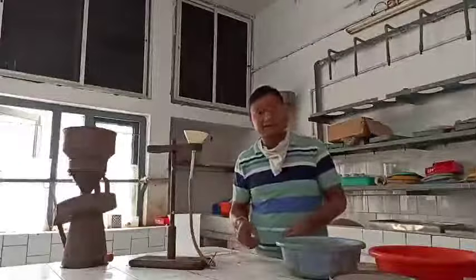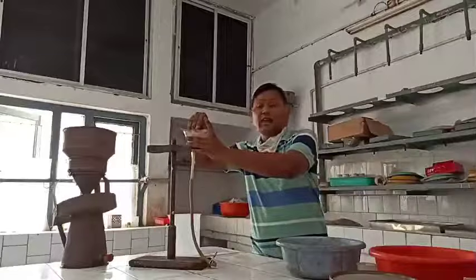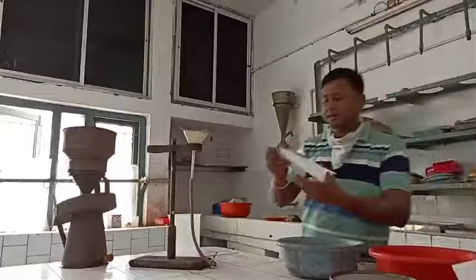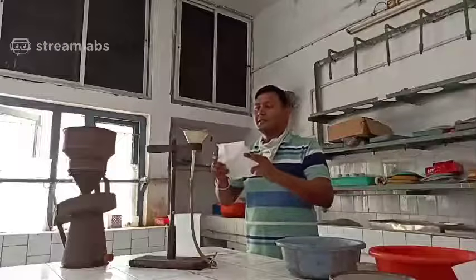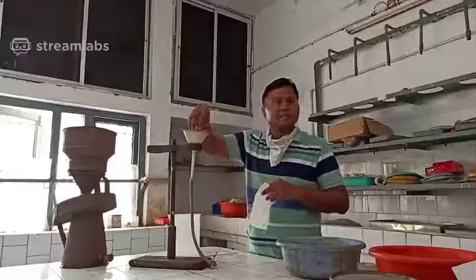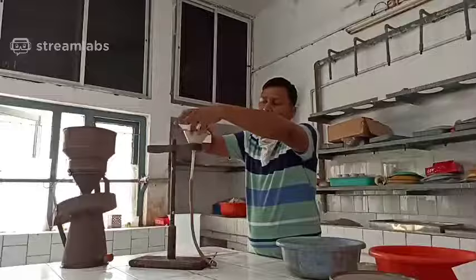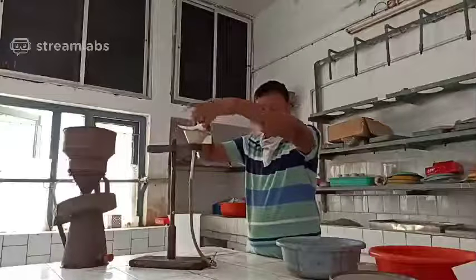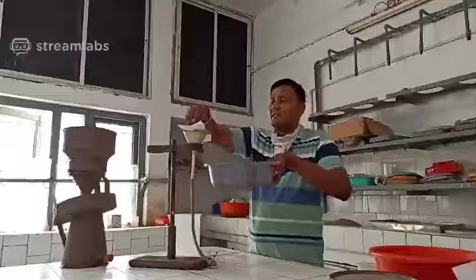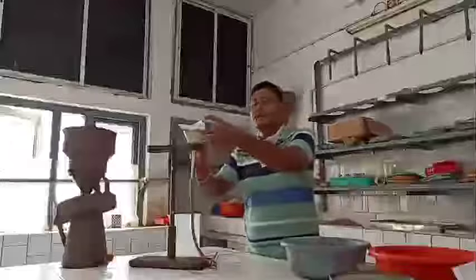Thereafter, this cotton bag was replaced by aluminum wire gauze and a tissue paper. In this method, the aluminum wire gauze is put on the funnel, and then the soil is put on the paper.